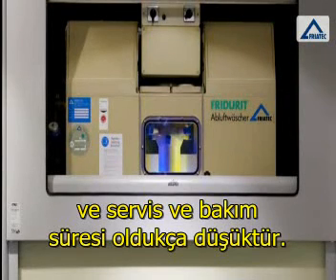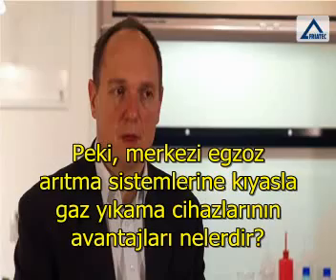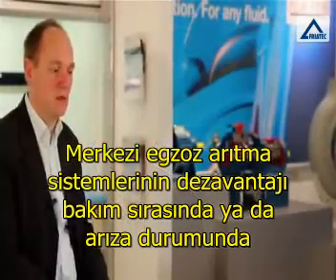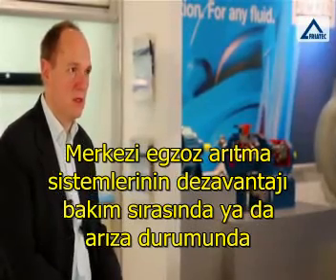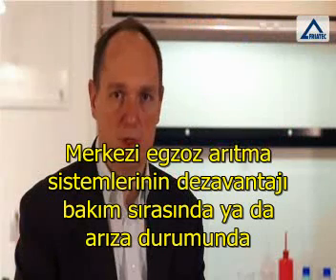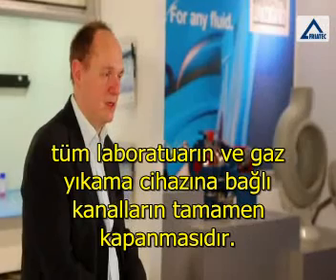And what are the advantages of fume scrubbers compared to central exhaust treatment? Central exhaust treatment has the disadvantage that in maintenance or in faulty situations, the whole laboratory and the ducts that are connected to the fume scrubber will be off completely.